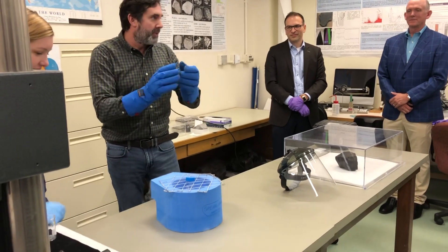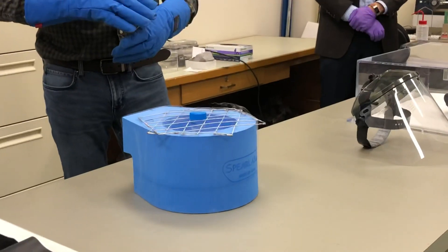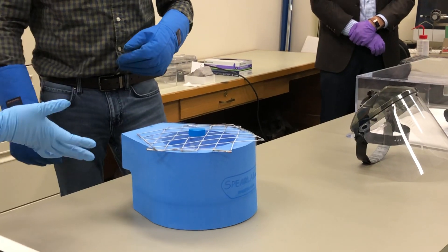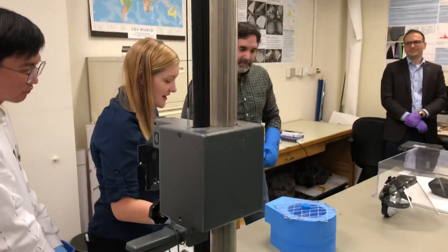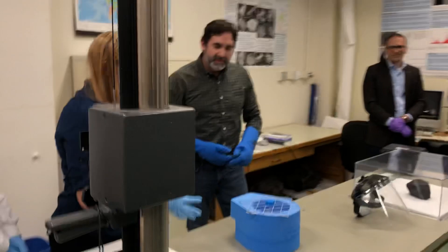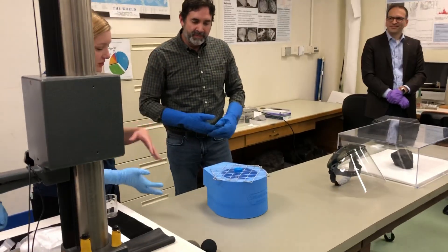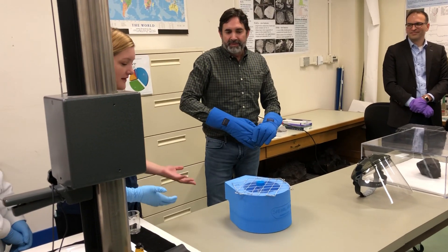As it hits the warmer object of the surrounding tube, eventually it'll stabilize and drop the temperature down to negative 320 degrees. One of the ways that we actually disaggregate these meteorites — or break them up into smaller pieces so we can analyze them — is by using a freeze-thaw method: cool the meteorite, then heat it up, then cool it again. But this is done in water, and it's done over many cycles.